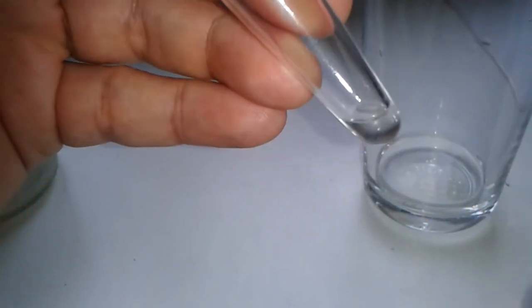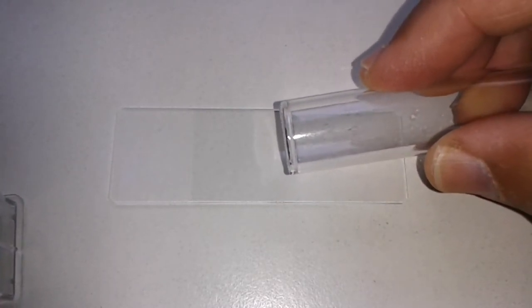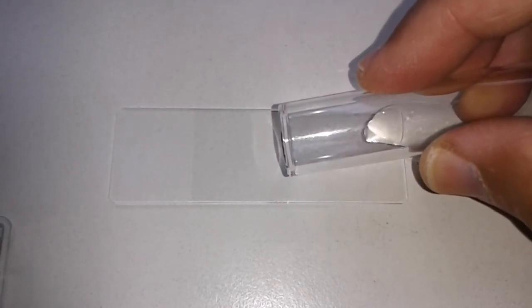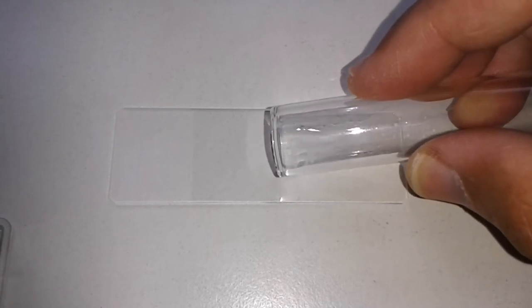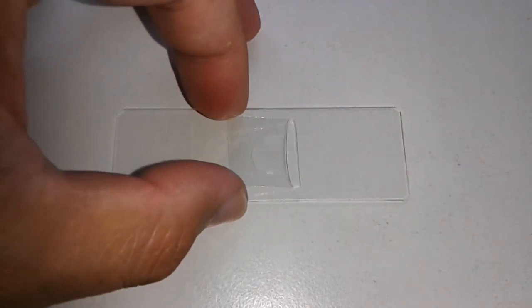And I'm now basically tapping the tube to resuspend the pollen in this small amount of water because the pollen is actually sticking on the glass. And pretty self-explanatory what I'm doing here. I'm taking a drop and I'm putting a drop on the slide. And then, of course, there's a cover glass.